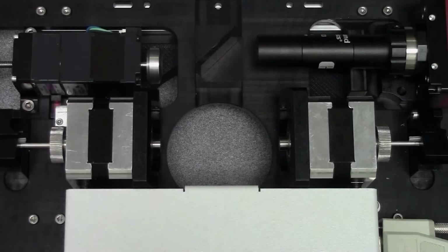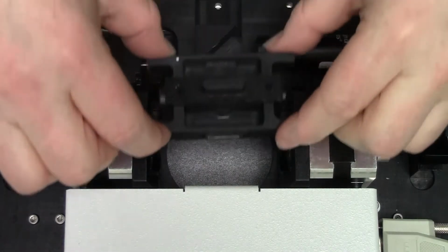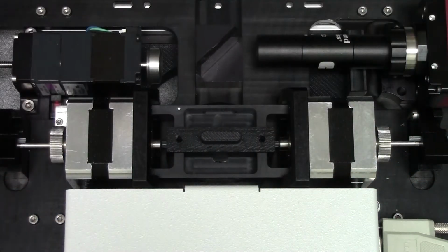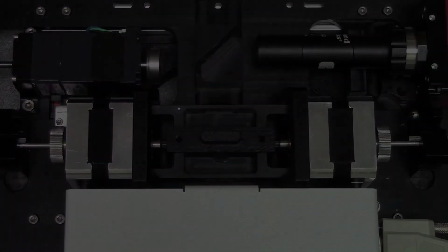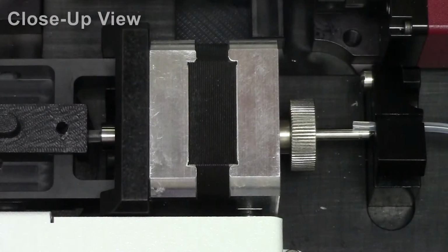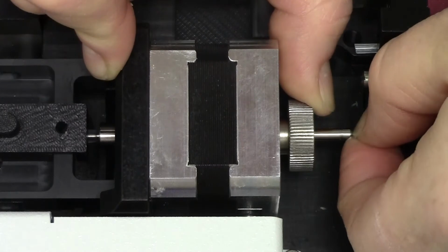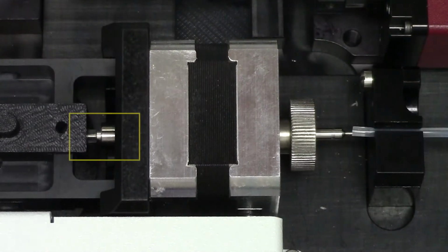Reinsert the capillary guard and gently place it over the capillary and positioners. Move the tray to its mount between the rotational motors, pressing down on the walls gently to secure it in the proper plane. Insert the feeder tubes. Depress the locking nut against the rotational motor and gently push the feeder tube into the silicon end until the metal shoulder rests against the silicon.